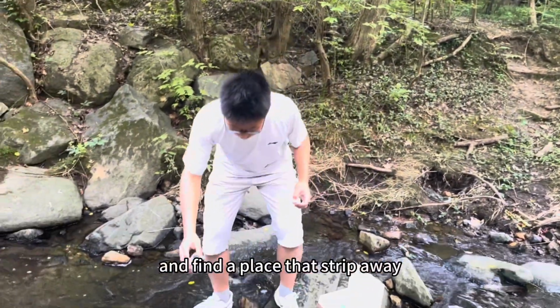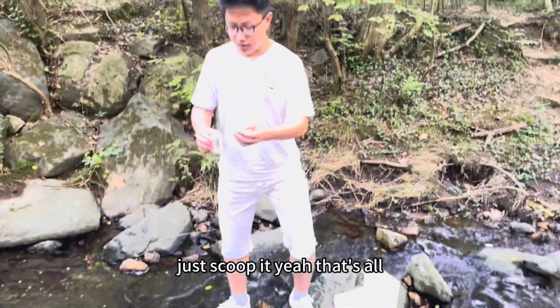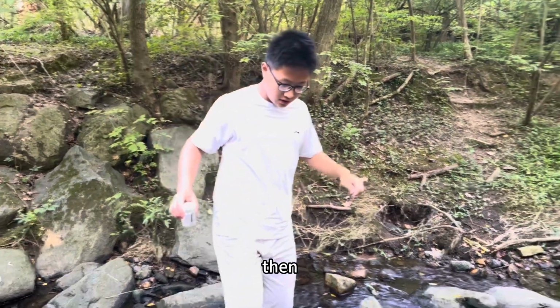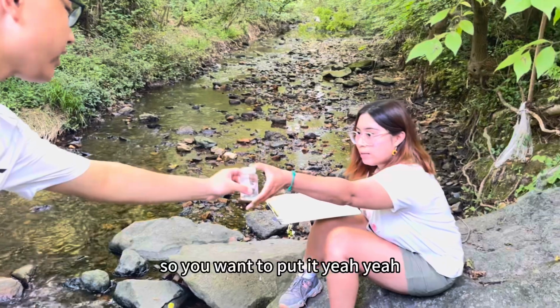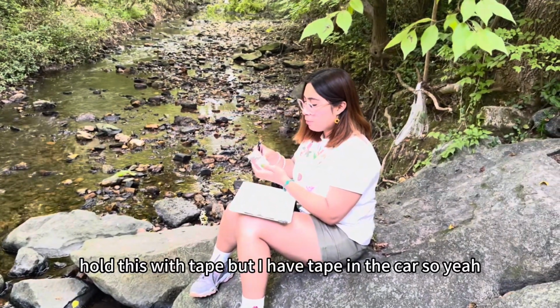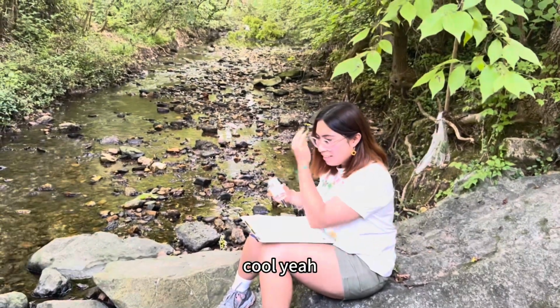Find a place that's flowing. Just scoop it. Yeah, that's all. Recap it. Then give it back. Then I'll just label this with tape. I have tape in the car, so I'll do that.